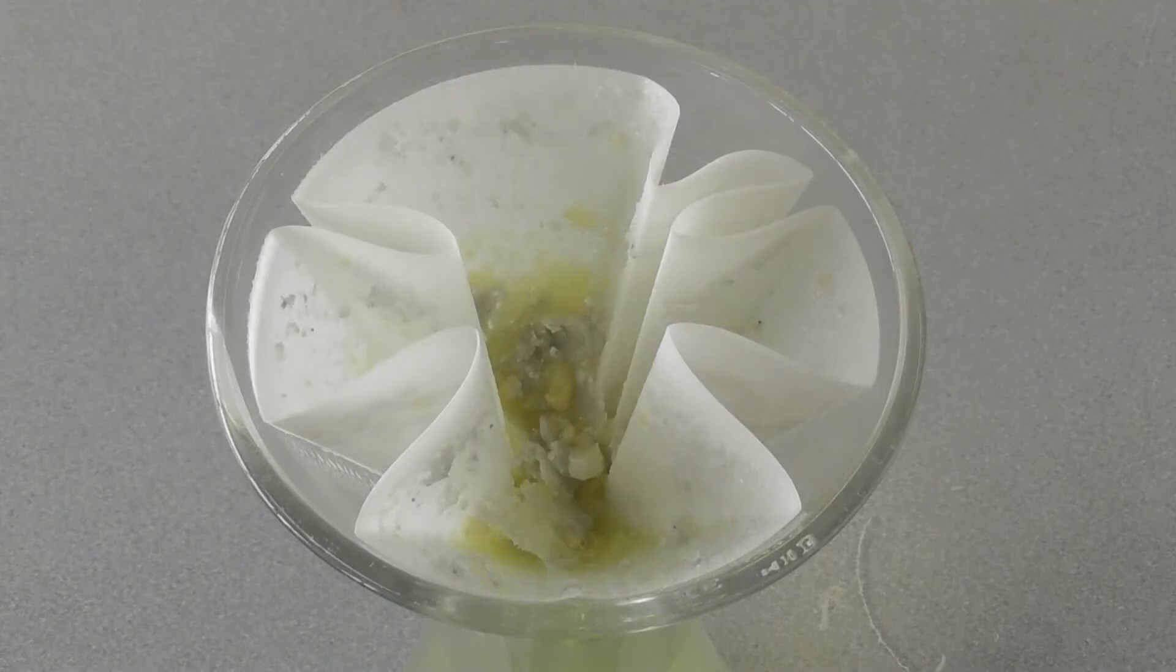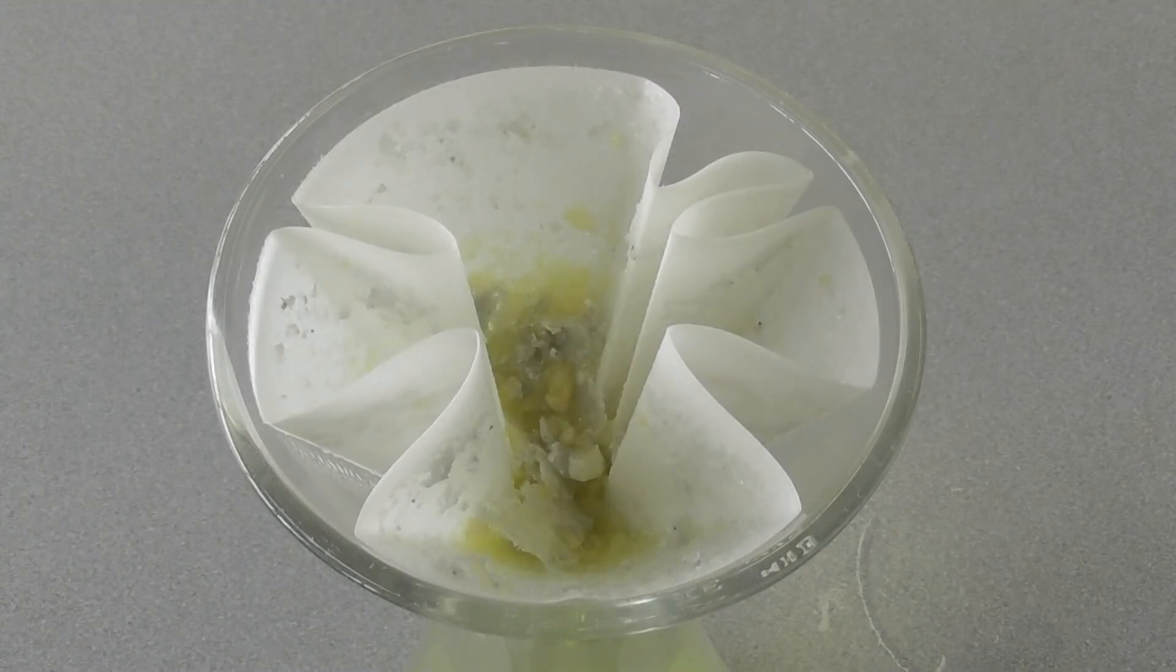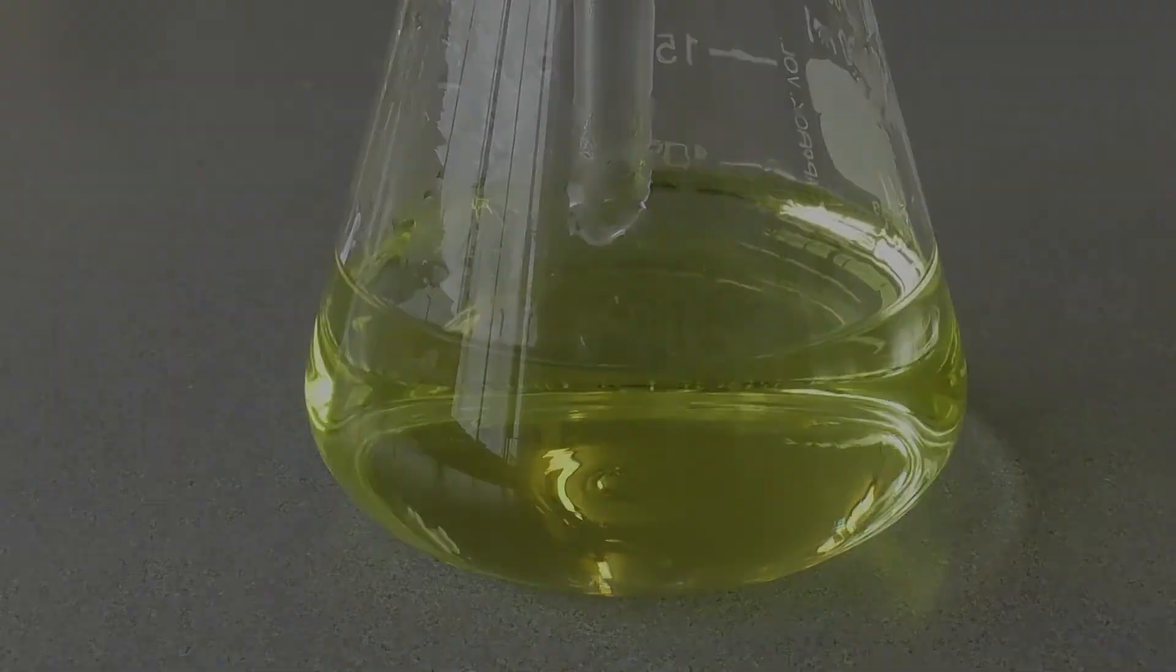As you can see, the insoluble impurities have been collected on the filter paper, and the liquid in the flask is clear.